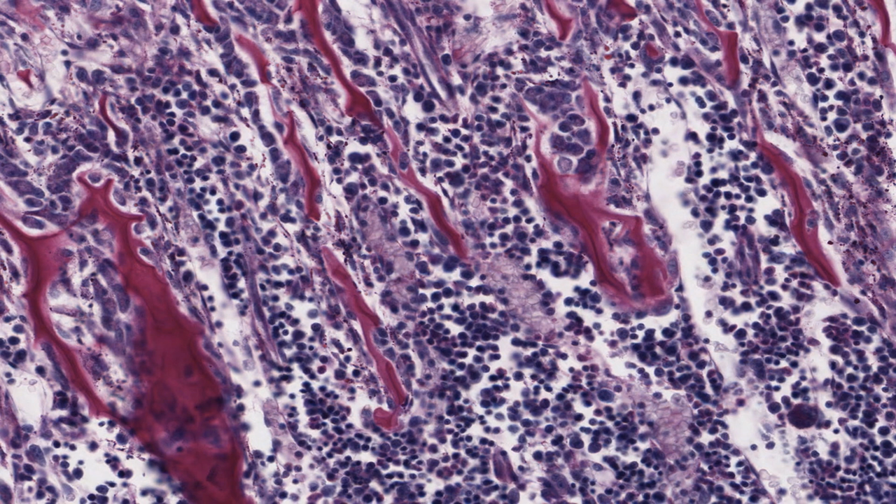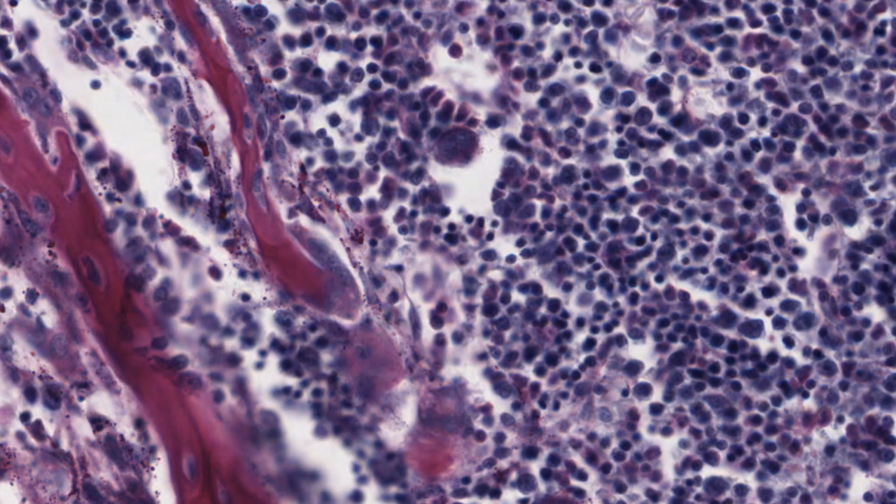Some of the nearby spindle-shaped cells are osteoprogenitor cells, but they can't be distinguished with certainty from the reticular cells that support the bone marrow between the spicules. The osteoblasts produce a thin layer of pink woven bone over the cores of dark purple calcified cartilage matrix. The layer of bone gets progressively thicker towards the lower end of the spicules.